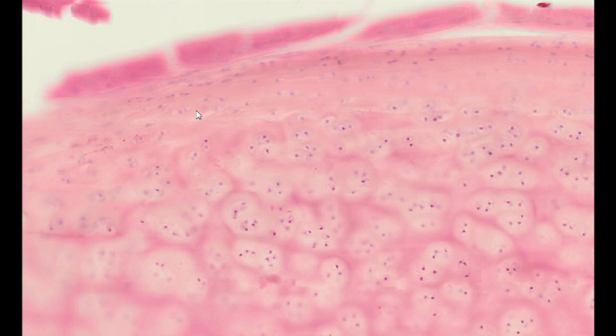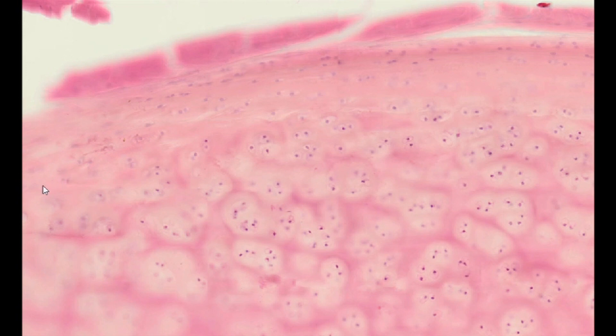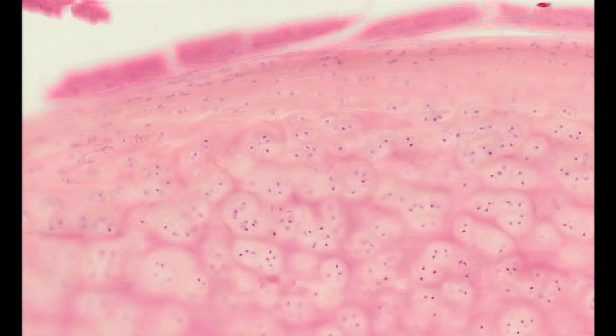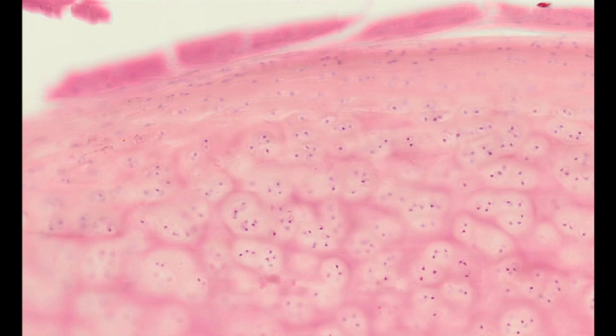With age, the volume ratio of collagen fibers to ground substance increases. The cartilage matrix is also degraded under pathological conditions. As a result, the integrity of the elements embedded in the matrix is lost. Thus, the histological specimen of cartilage allows not only to identify the structural elements of the cartilage, but it may be a source of information that is the basis for the assessment of cartilage destruction, both in the case of degenerative changes, as well as mechanical trauma and overload damage.